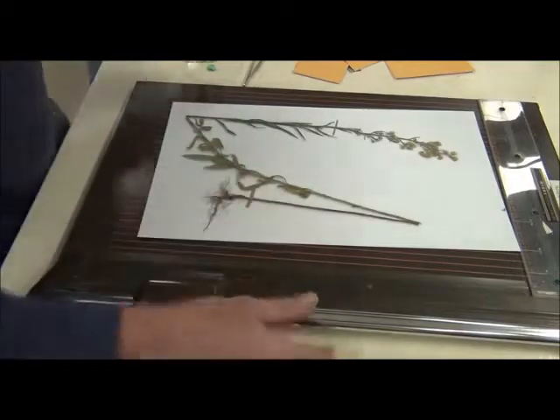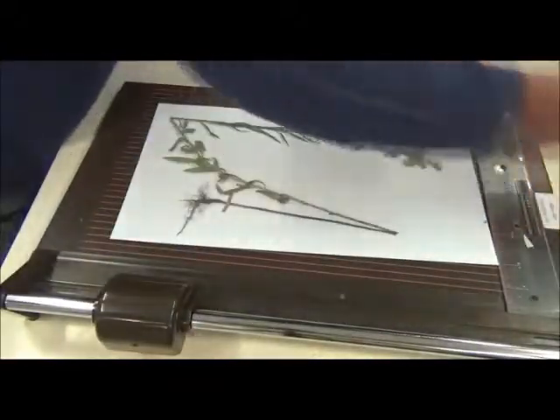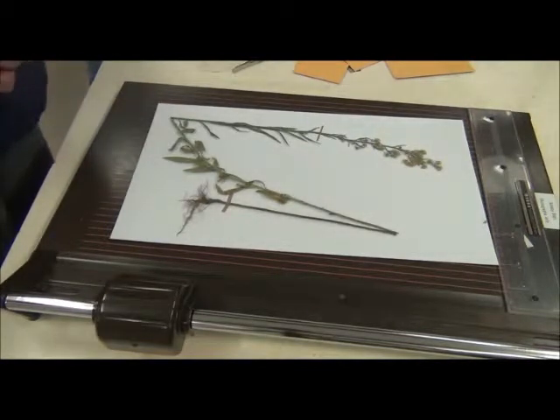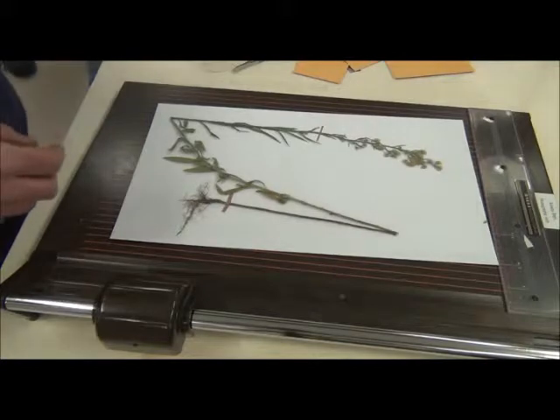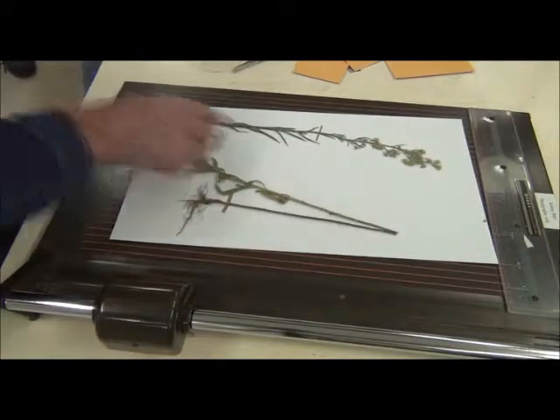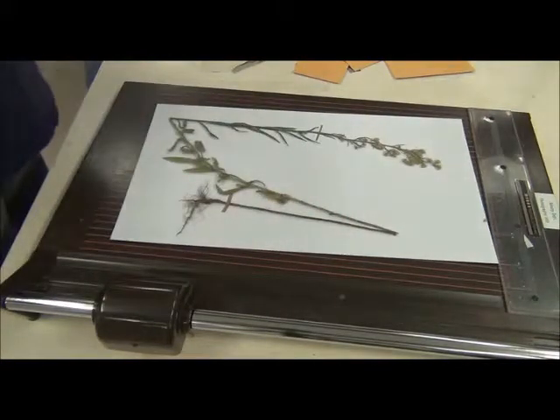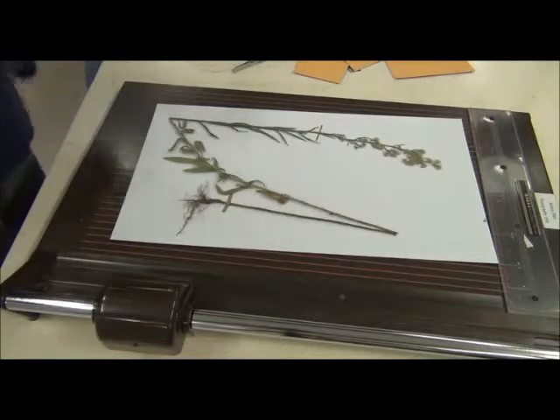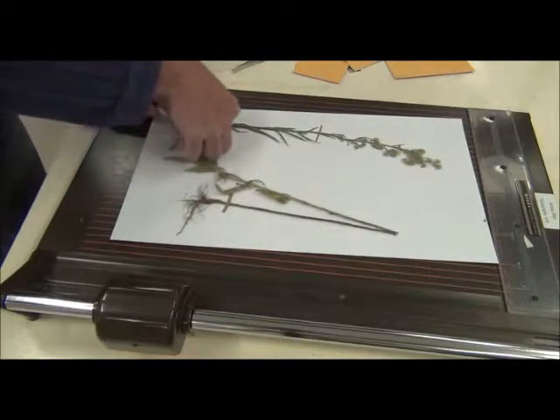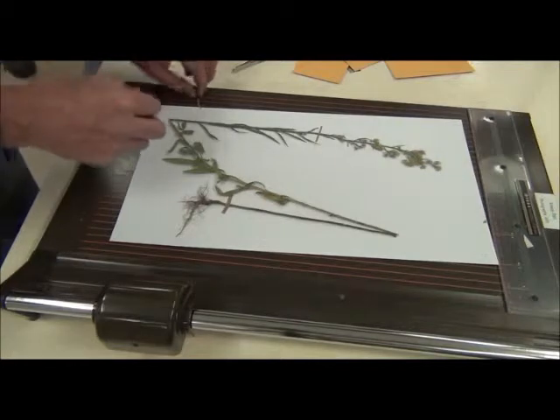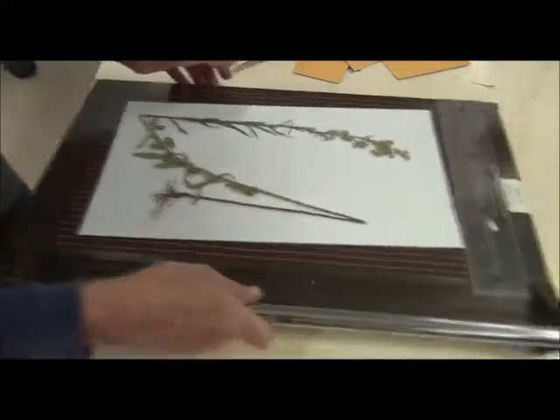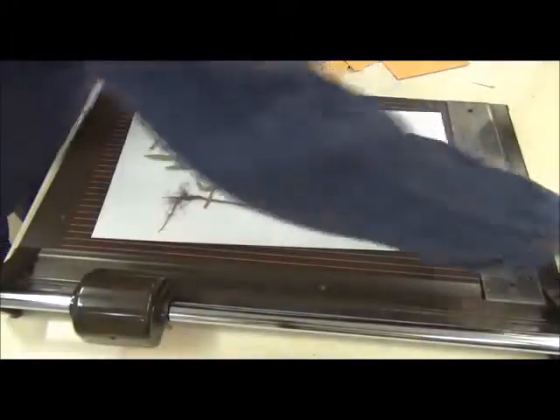And even that's... Yeah, you see, I need another one, don't I? So, I need one more thin piece. And some people might put one up here and down there. So, as a rule of thumb, if the minimum you can put that sort of really anchors it nicely, it's not to prevent a tornado. That was my off cut. I need... Here we are.